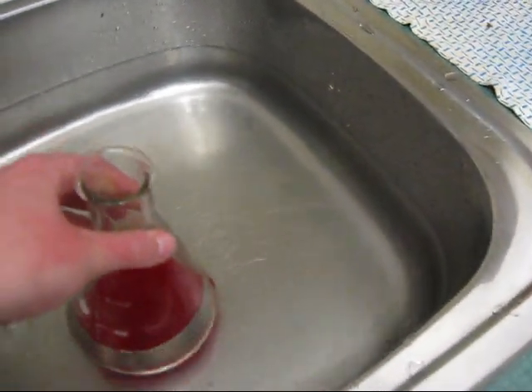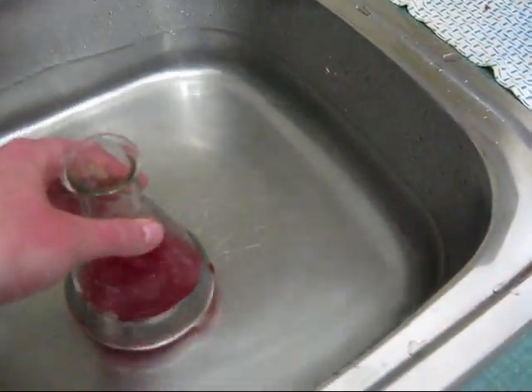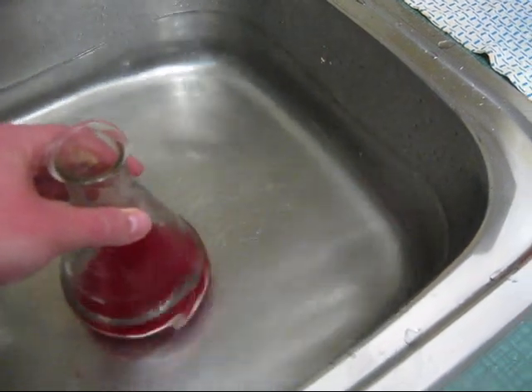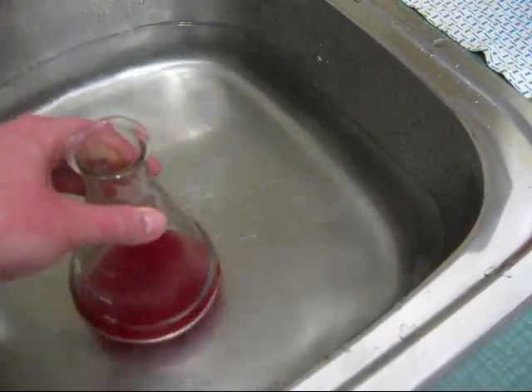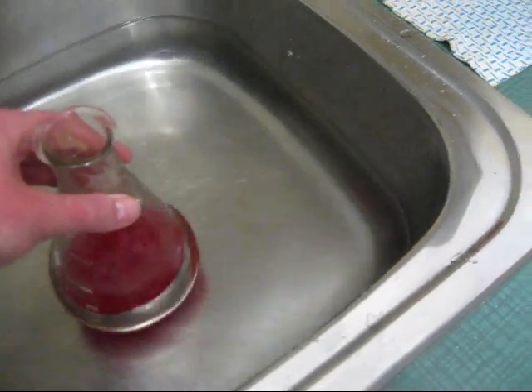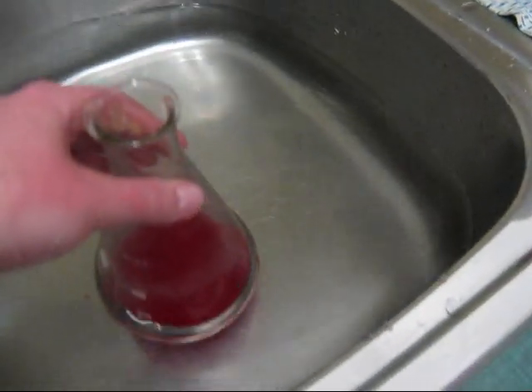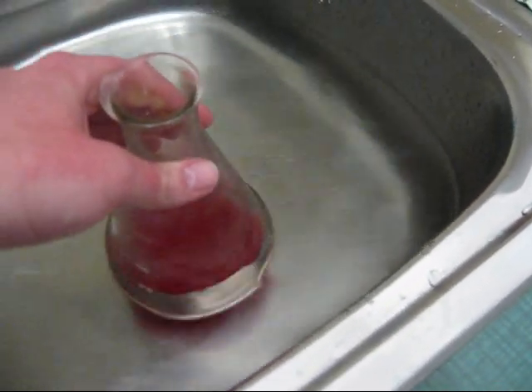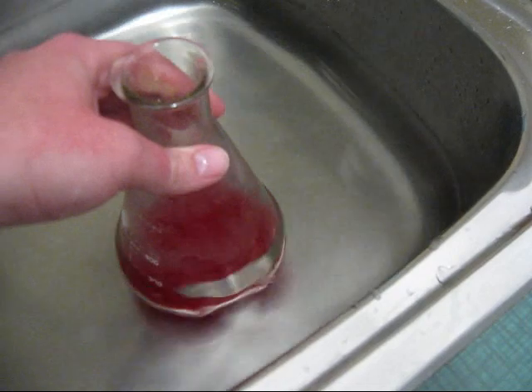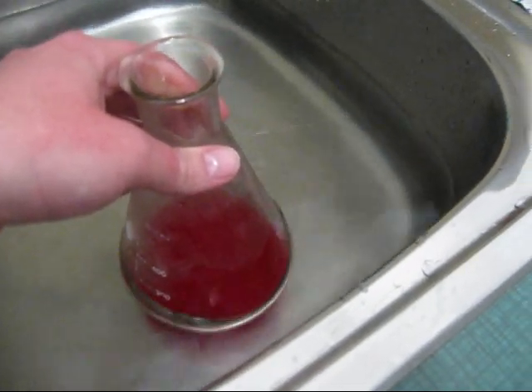Okay, so next I will take these beakers here and put them in about 60 degrees Celsius warm water, and slightly heat the mixture of each of these beakers for about 15 minutes. This will actually help to break up the cells and free the DNA, but I need all of my hands for that.